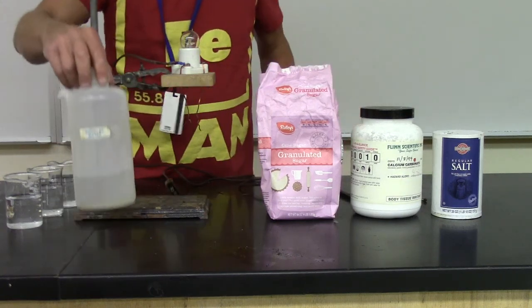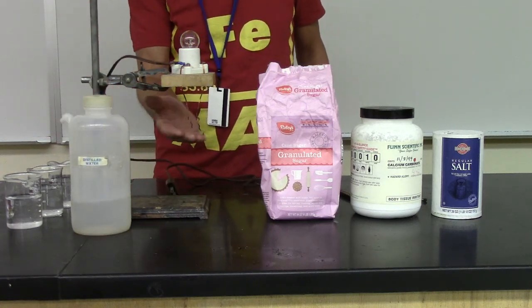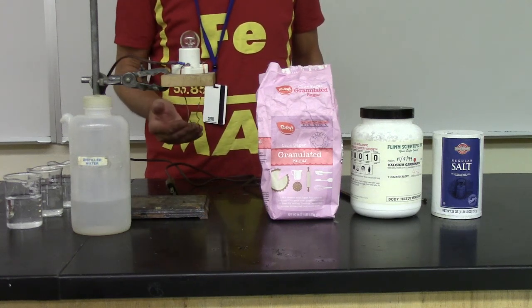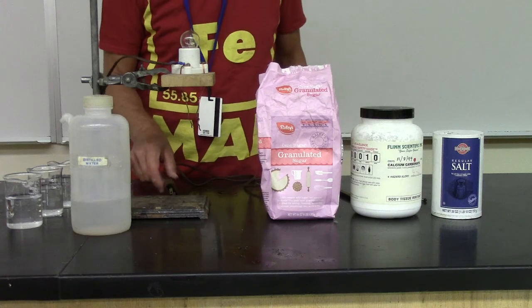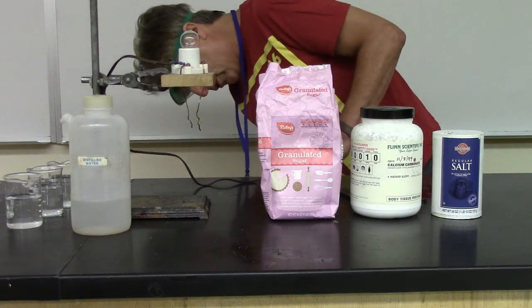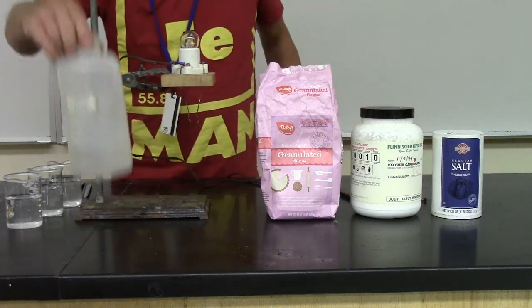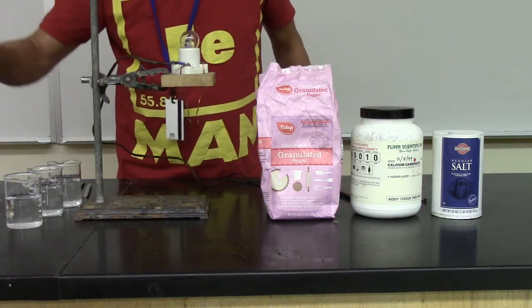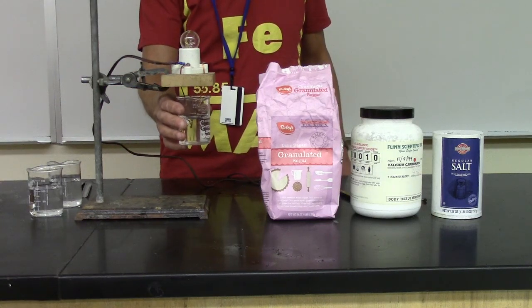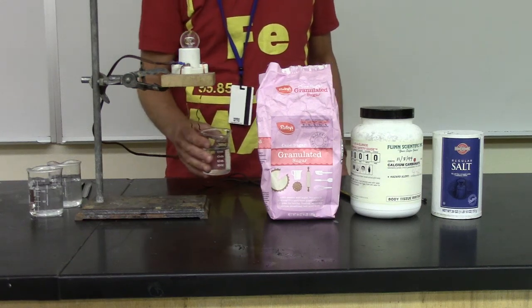So now, what I have here is some water. Does the water conduct electricity? If we put something between these two wires that conducts electricity, the light bulb will light up. The more electricity it conducts, the brighter the light will be. Does pure water conduct electricity? I have now plugged it in. I have taken some of this pure water and put it in this beaker right here, and we shove it in there, and we have no electricity. So, pure water does not conduct electricity.